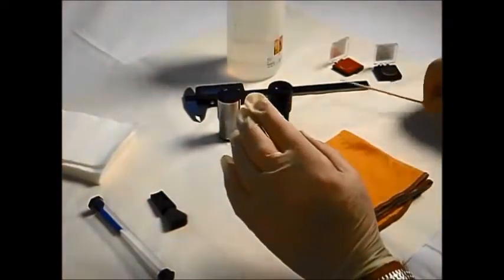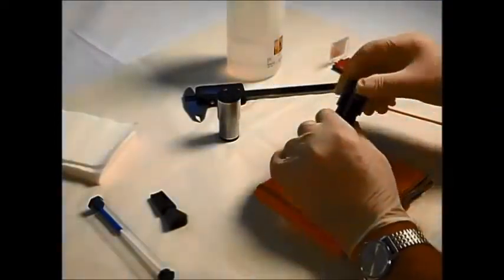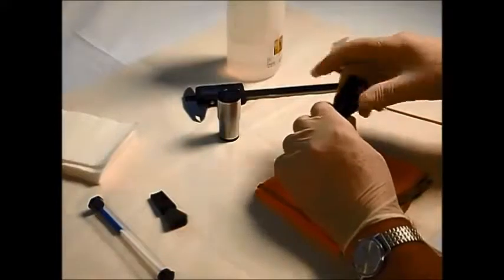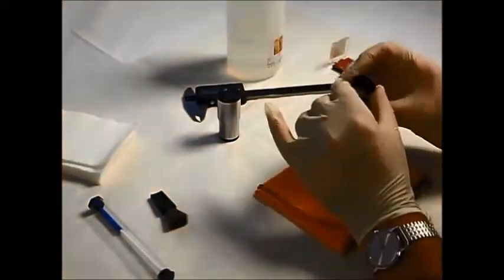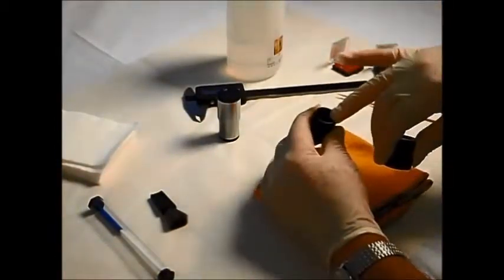Now, one of the most common causes of contamination comes actually from the eyepiece itself. When you unscrew an eyepiece assembly like this, you can get small fragments of the black coating come free and they fall inside the actual eyepiece. Now, when you reassemble, this later falls down onto the eyepiece reticule.